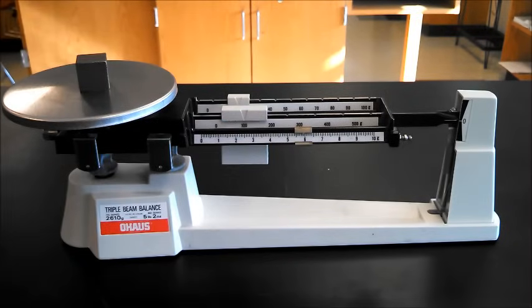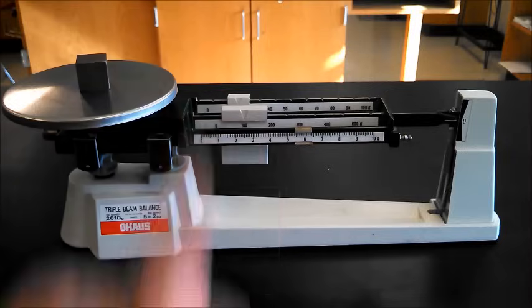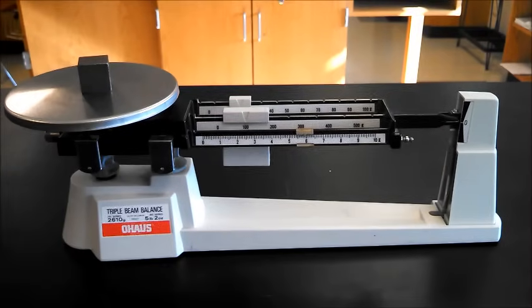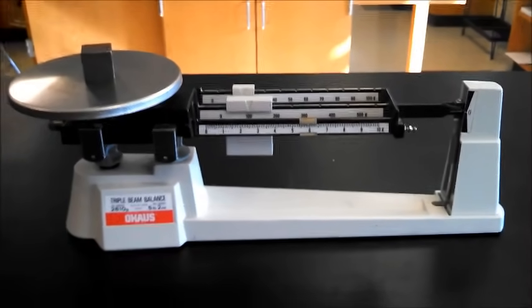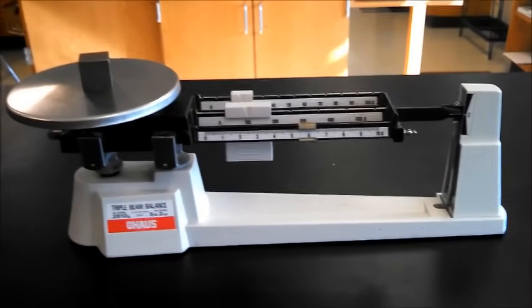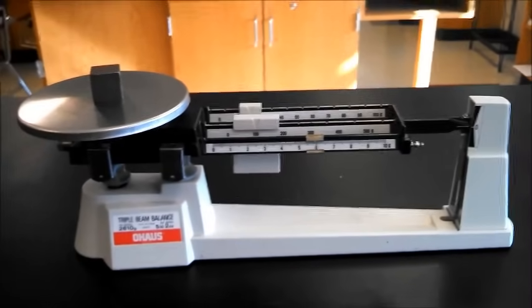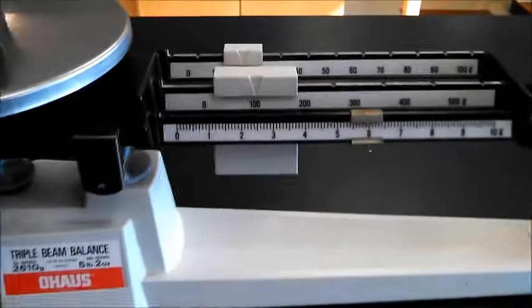Now, how do we know what the mass is? What do we do with these numbers that they're lying on? Well, let's go ahead and take a closer look to see what we really need to do in order to find out what the mass of this cube is.